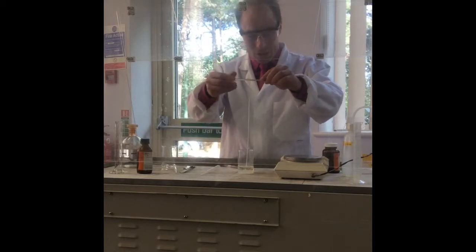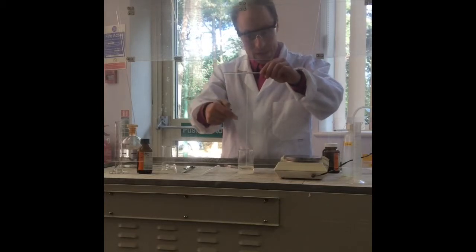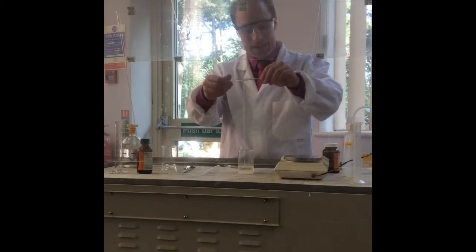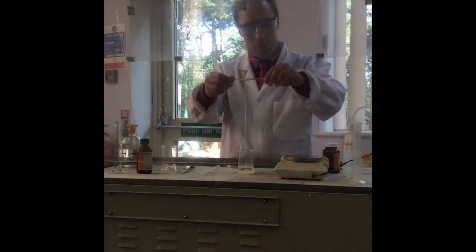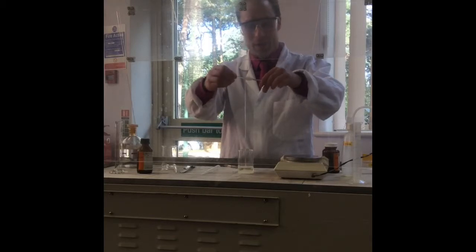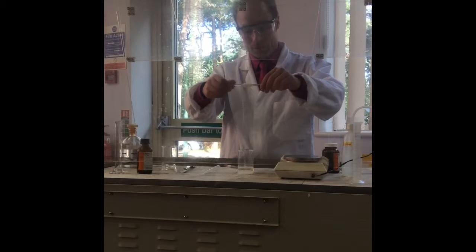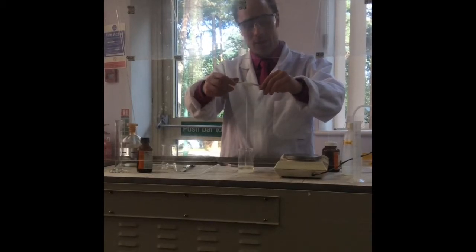Now, it's a tube. In the middle of the tube are the reactants that haven't fully reacted together. So you'd have to wash this quite a few times. But that's coming out nicely, isn't it? You can go quite fast. Can I feel it? No. It's like a cocoon. It looks like wool. A little bit, yeah. It's coming out quite nicely, and you can see how smooth it's coming out.